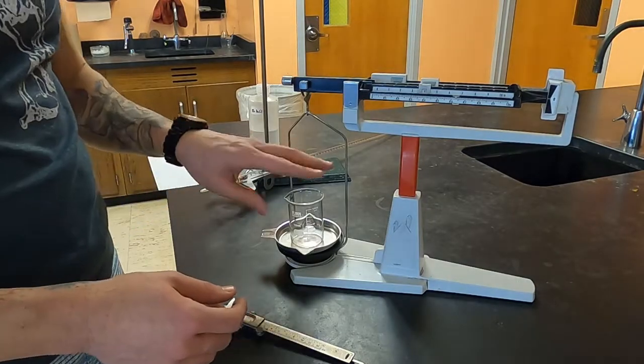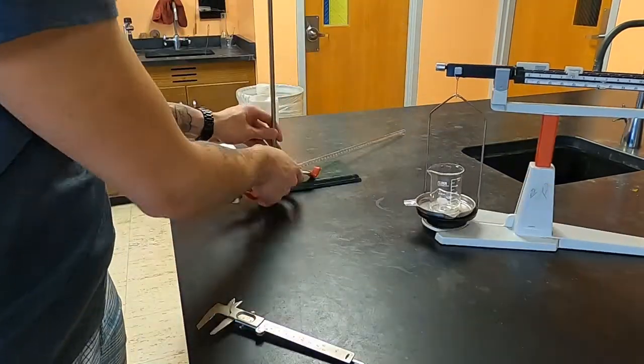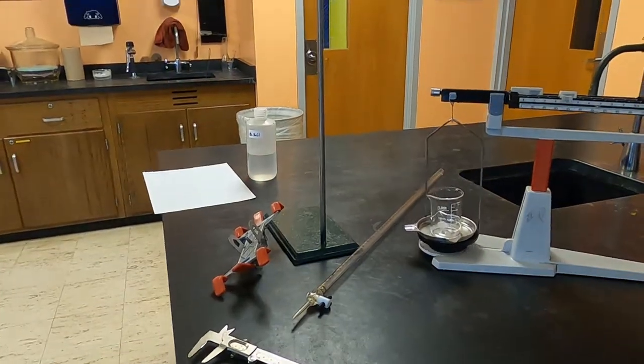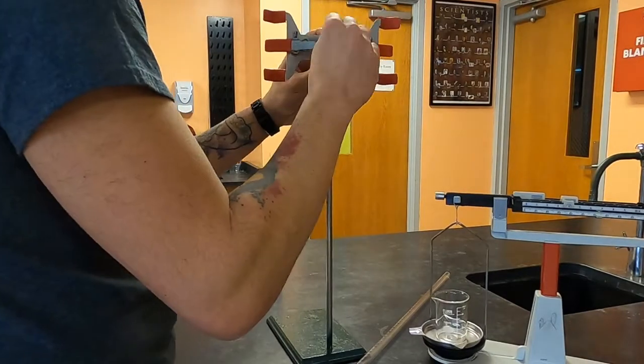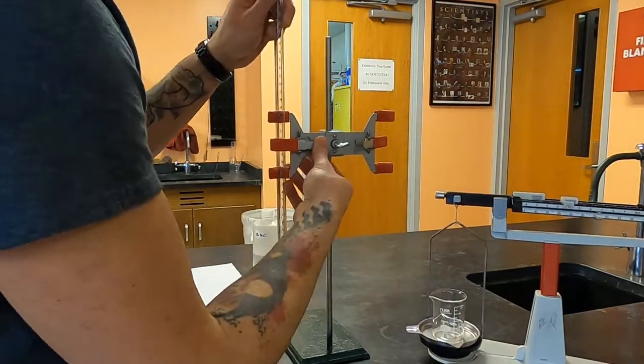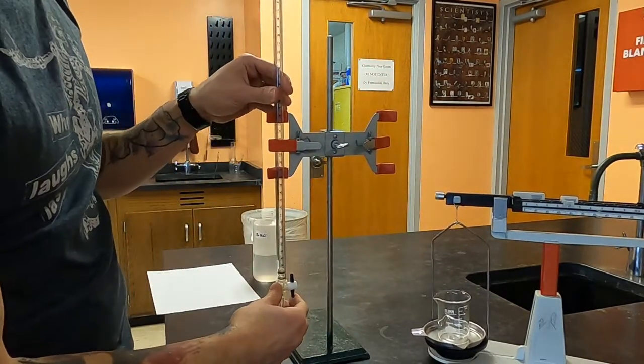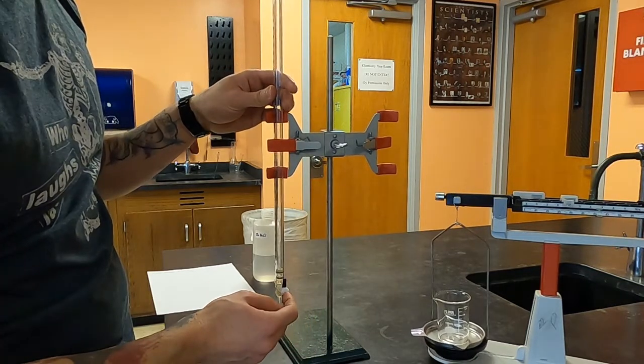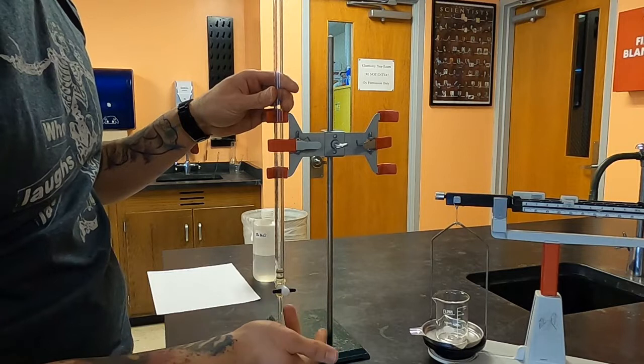Next we're going to set up our burette. Make sure before you pour anything into the burette that this inline means open. Make sure that it is closed.